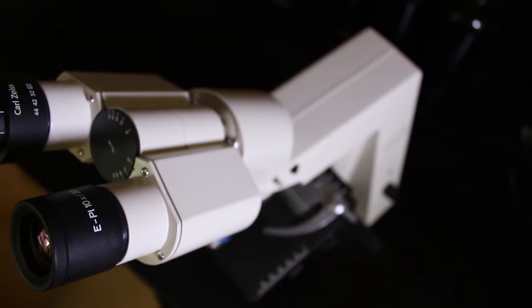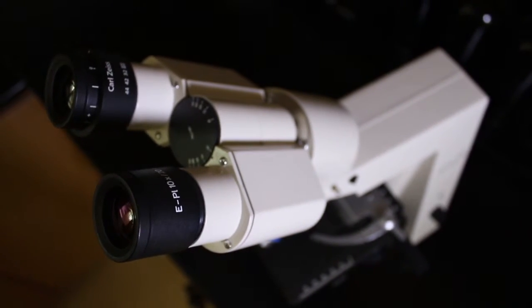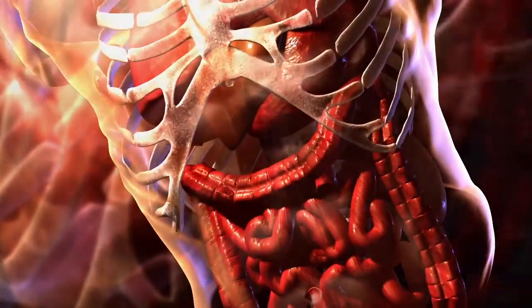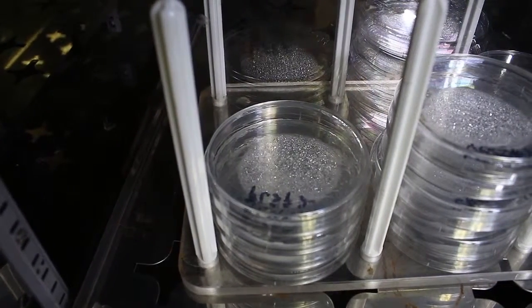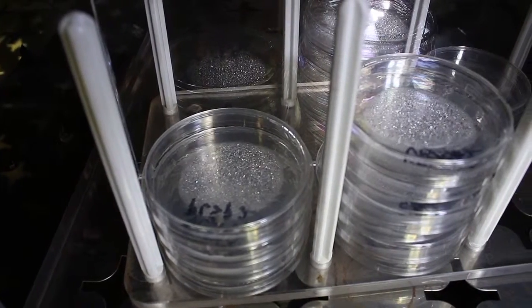However, remember that fecal coliforms are of greater public health concern than the larger total coliform group, because the fecal group normally is found in the intestines. This means that another test must be performed to determine if our total coliform positive sample also contains fecal coliforms.